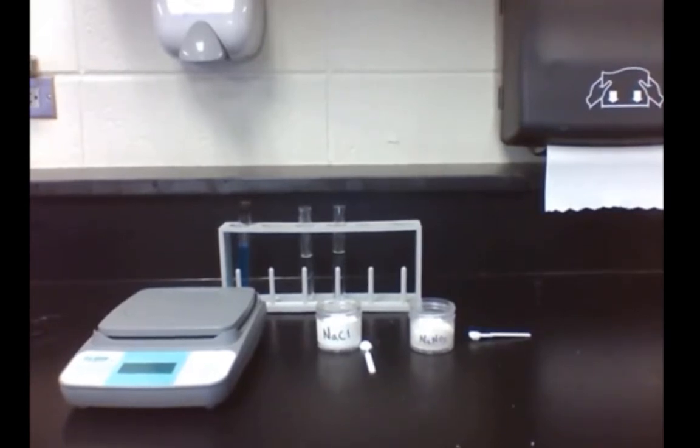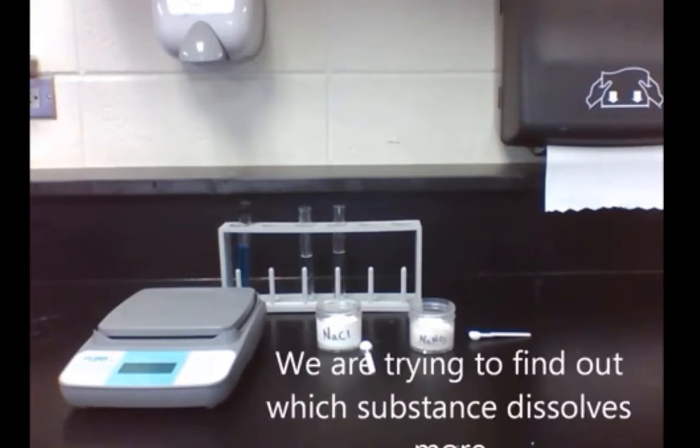In Lab 13.2, we're going to find out how much of the two substances, sodium chloride and sodium nitrate, will dissolve in equal amounts of water.